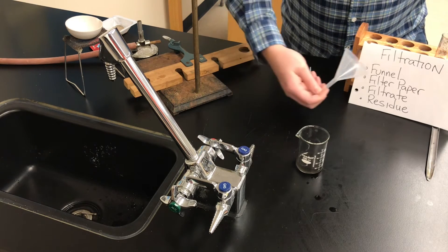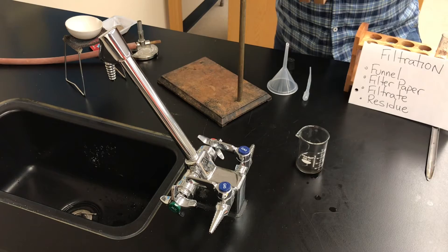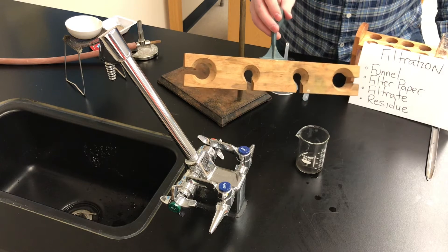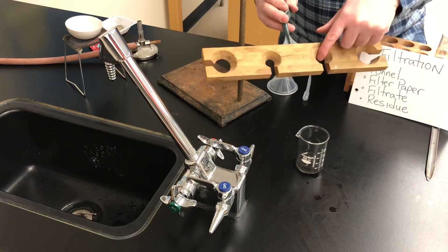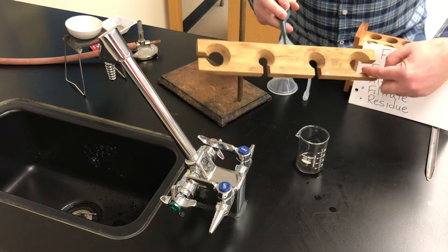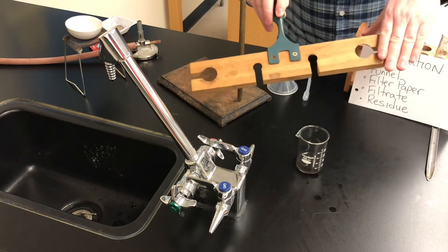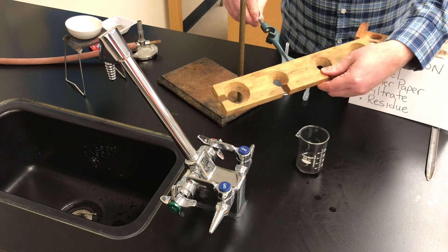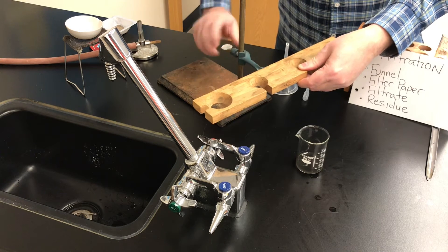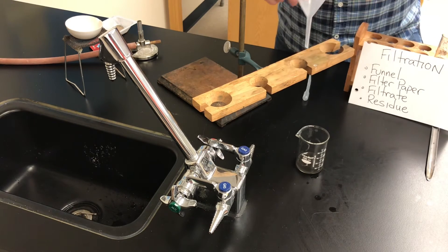Here is a funnel, and over here I've got a support stand — these are underneath your bench. In the drawers in our lab we have these clamps — this is a filtering clamp or funnel clamp. On one side it has beveled holes and on the other side it's just flat. I'm going to have the beveled hole facing up and the flat side facing down, and I'm going to slide it onto the support stand and tighten it to hold it in place.